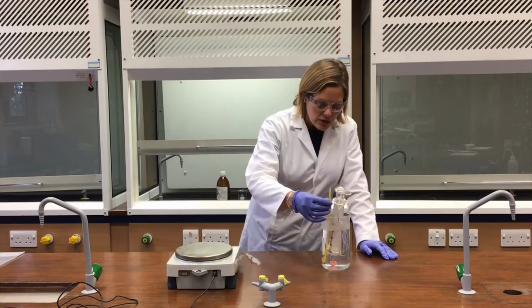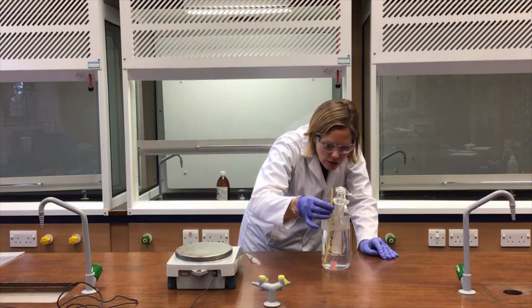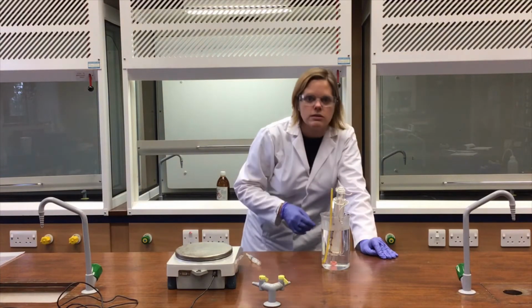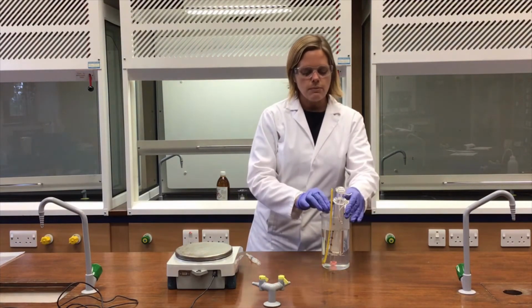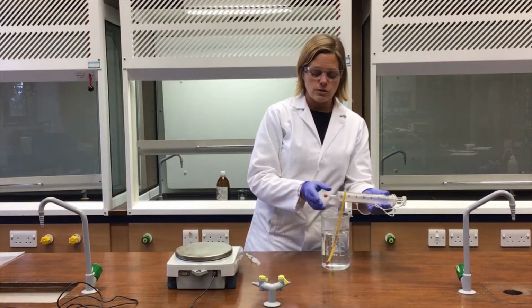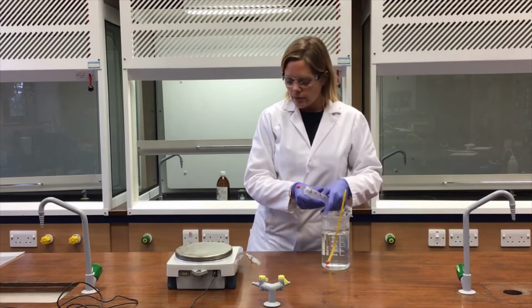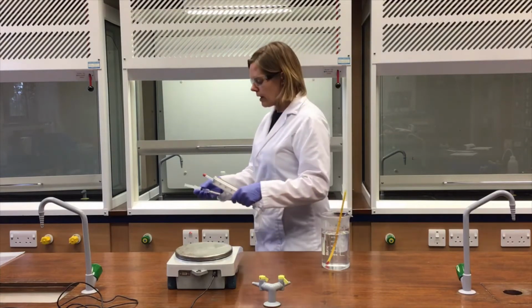Before I do that, let me just check that that volume has not changed. It hasn't, and the temperature on that thermometer is 81 degrees C, so that should be plenty hot enough for what I need to do next. So I'm going to just temporarily take this gas syringe out of the hot water bath like so. It's quite warm, so I need to be careful. I'm going to move everything into the fume cupboard to inject a little bit of hexane, then I'll bring it all back out when that's safe again.